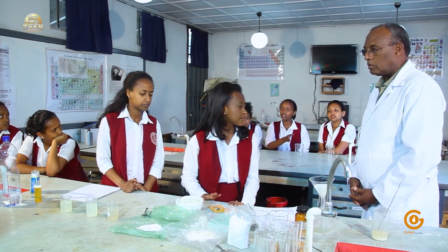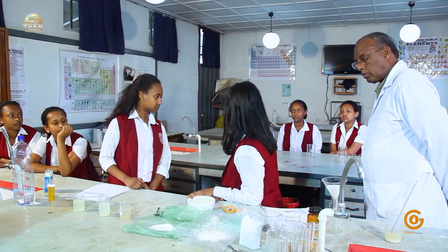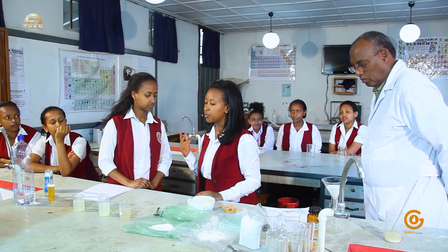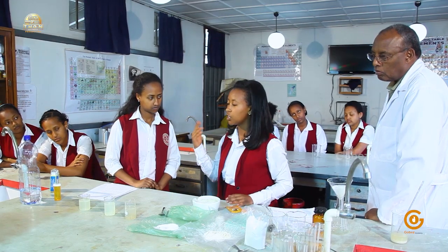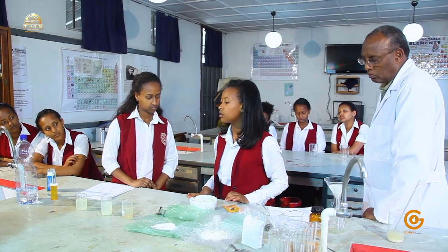You added equal amounts of water and lemonade to the beakers. What would have happened if you had added different amounts of water or lemonade? Can I answer your question? If we put different amounts of solid and water, we wouldn't have seen the effect of stirring and the change in surface area of the sugar we used here.